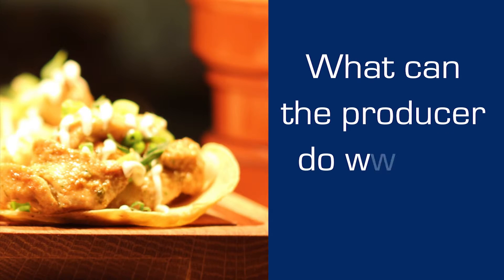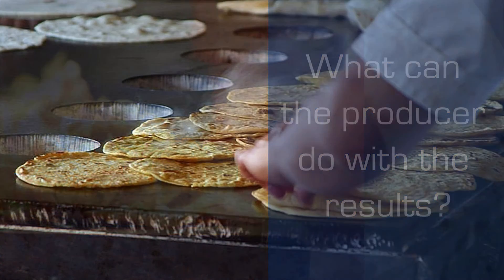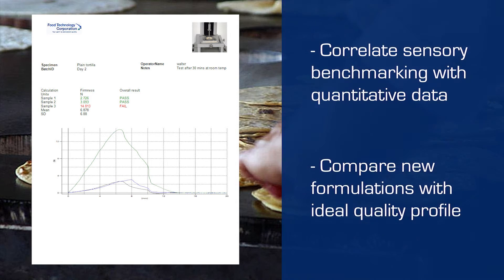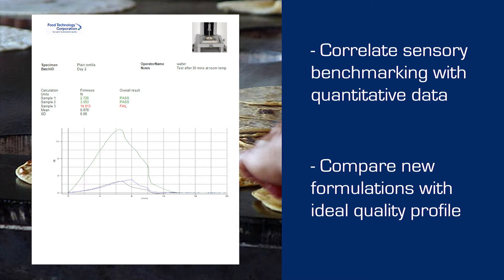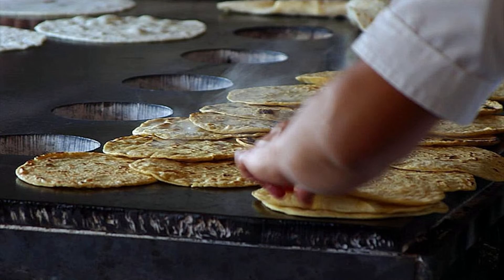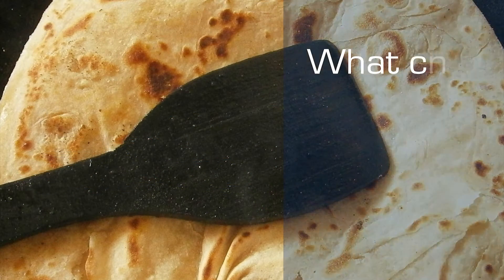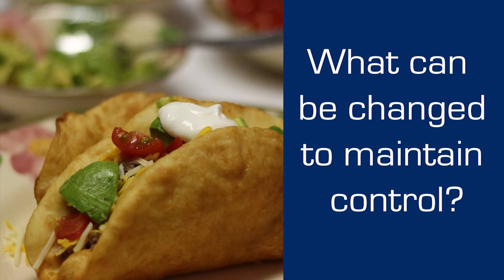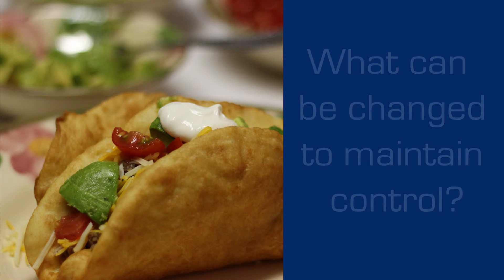Analysis of the measured data brings understanding to the effect of variables in the food supply chain, and therefore the ability to optimize quality. With an accurate and repeatable texture analysis capability, the producer of soft flatbreads can evaluate the performance of different variants — such as wholemeal, leavened, or unleavened — and of course the effect of staling over time, and then make recommendations for packaging and storage.